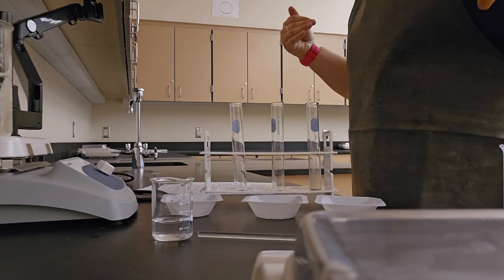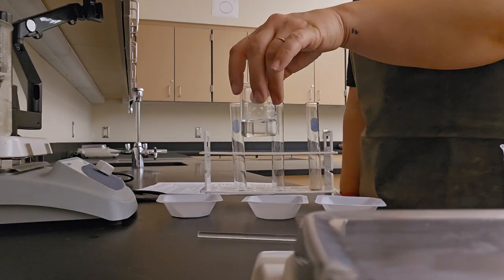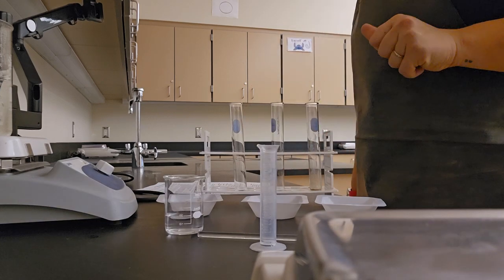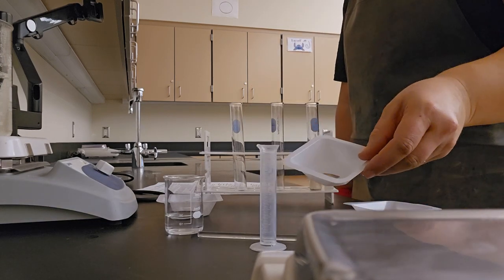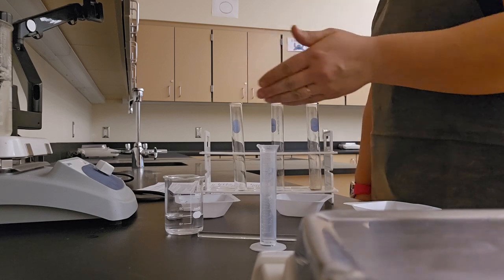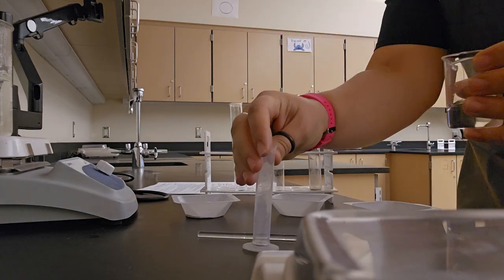I have still stayed dressed for lab, and I have grabbed my materials. I have 3 test tubes this time in my test tube rack. I still have my 20 milliliters or so of 3% hydrogen peroxide. I have my 10 milliliter cylinder, and this time I have an apple slice, a potato slice, and a yeast sample. So my test tubes are in, and now I'm going to start on number 4 again and measure 2 milliliters of hydrogen peroxide into each test tube.